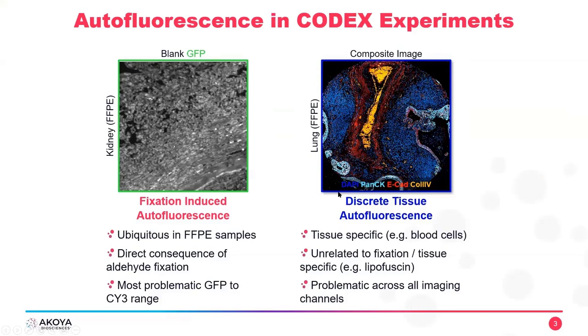On the right side here, you have a core of a TMA that contains lung tissues. Now, this image is a finished image. That means it has several imaging channels merged, and they're assigned pseudo colors. Normally you would see collagen in yellow. You can see little areas of collagen here. But you also see this massive yellow golden area in the middle of your core. Turns out that these are actually erythrocytes, or red blood cells.